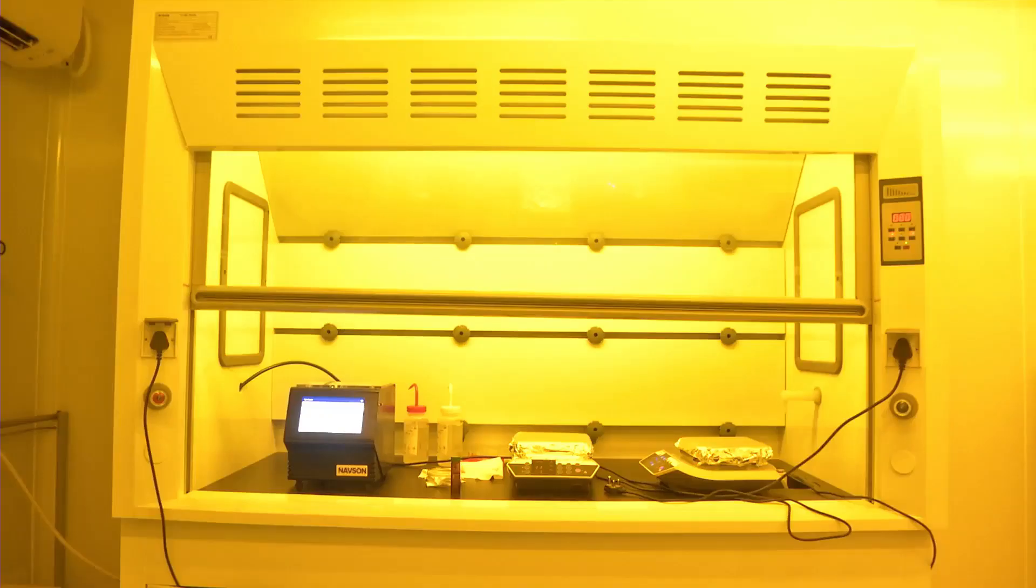Hello everyone. Today we are going to see how we can spin coat polymers to obtain flexible substrates. We are going to use a precursor similar to what you have seen for photoresist spin coating.